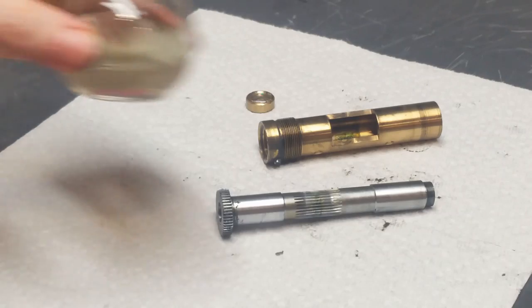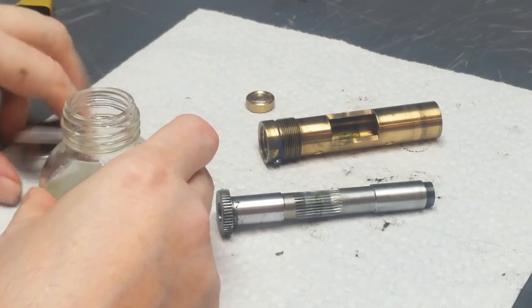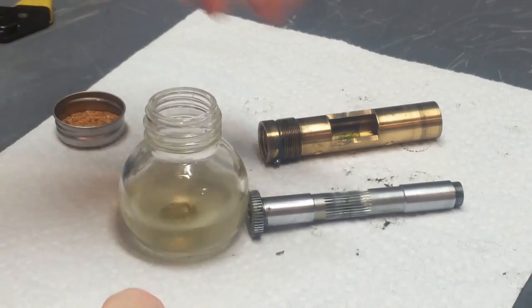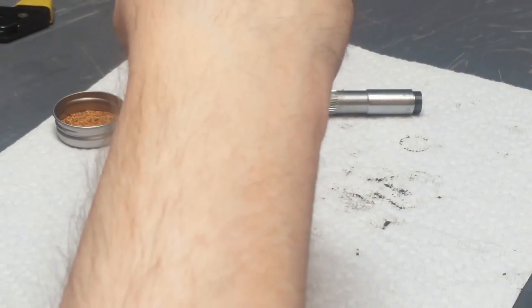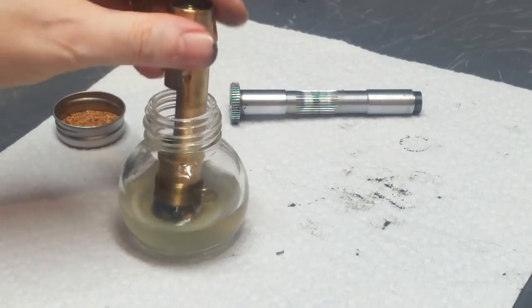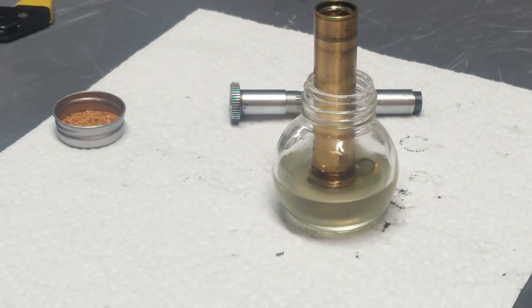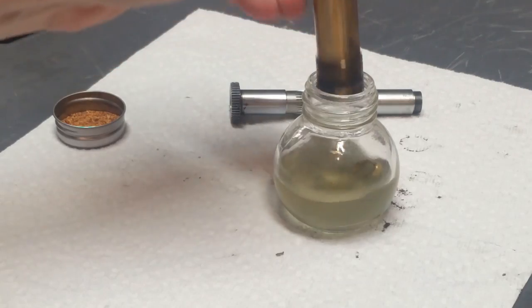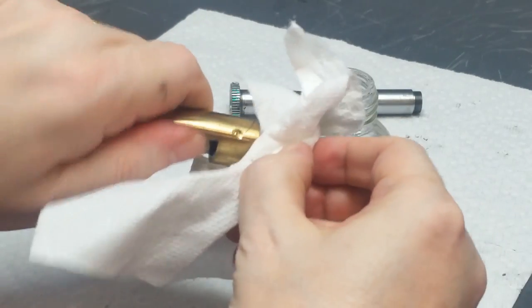Okay, now I have some somewhat dirty mineral spirits, and I'm going to use that to clean some of these pieces off. I'm just going to drop that in there and let it soak. Let that soak for a while. Okay, that's soaked for a while. Now I'm going to see if I can remove this. I'll clean this off just with a paper towel.